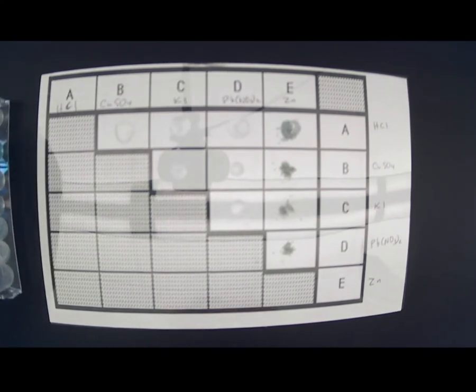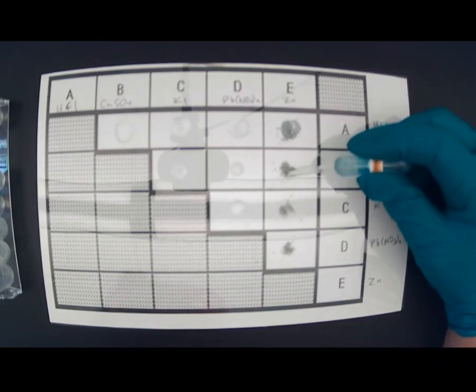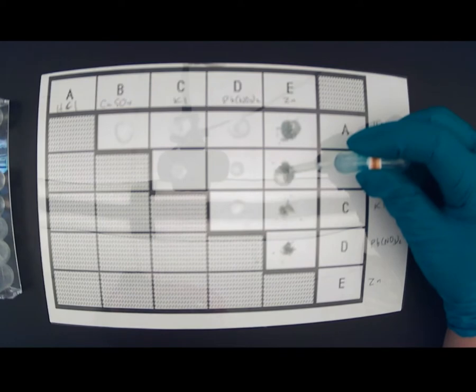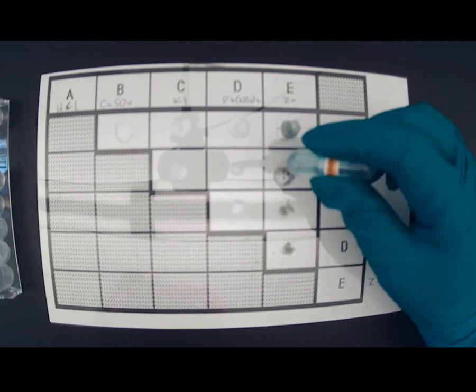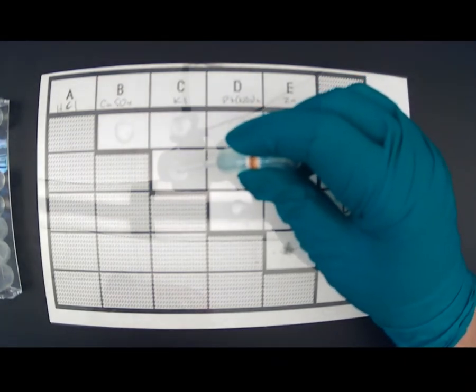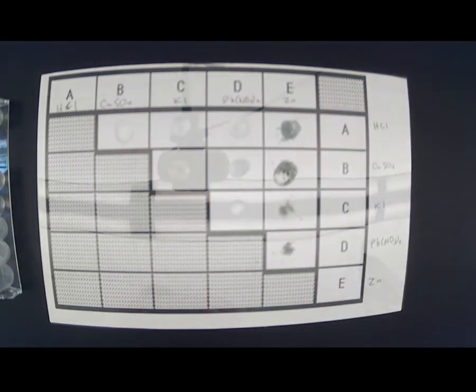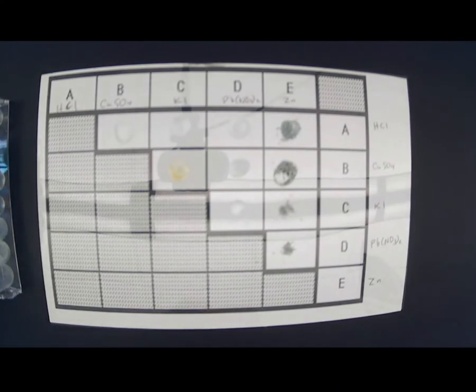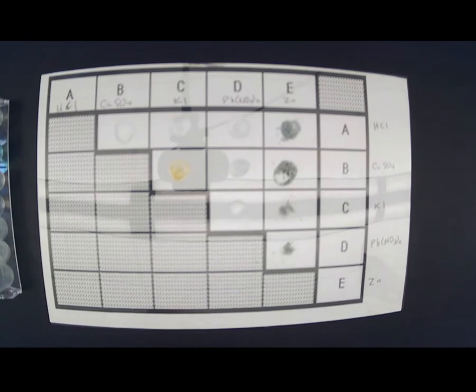Next row is copper sulfate. I'm going to put a drop of copper sulfate here, one here, one here, and one here. You can see some color developing there already.